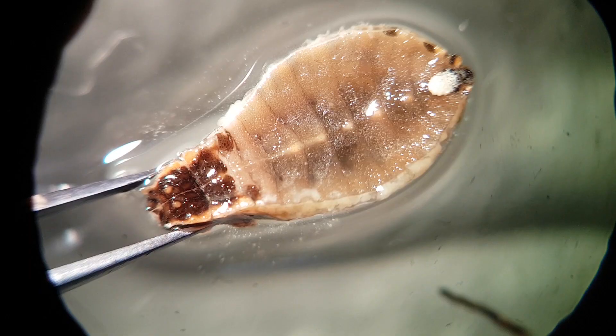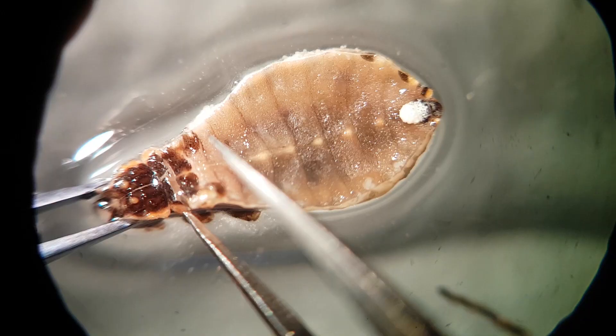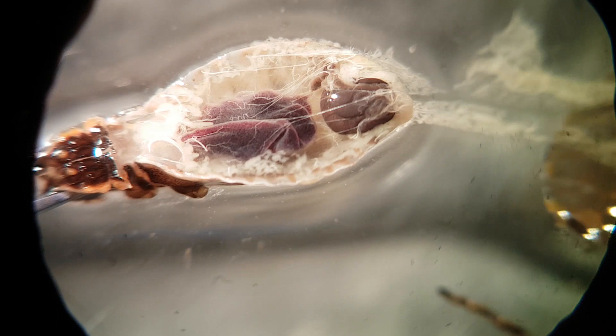Submerge the bug in dissection solution and then cut the upper abdomen plate transversely near the thorax. Then, using tweezers, lift this plate to expose the gut, just like opening an oyster.